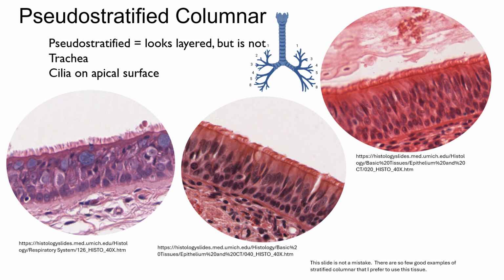These slides here are from the trachea, and they all have a feature on them that we will not see on any other epithelial cells. These all have cilia on them. Cilia are like little projections, much smaller than villi in the small intestine. And cilia, they all wave in a coordinated fashion. And in the trachea, they move mucus superiorly.